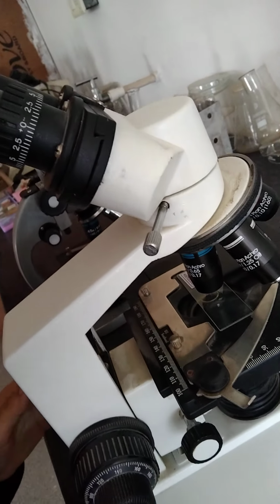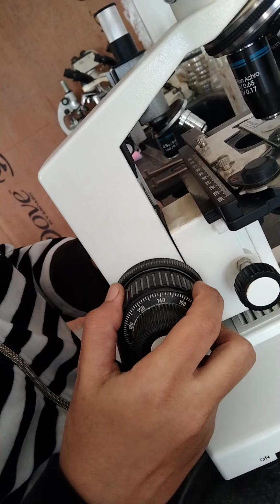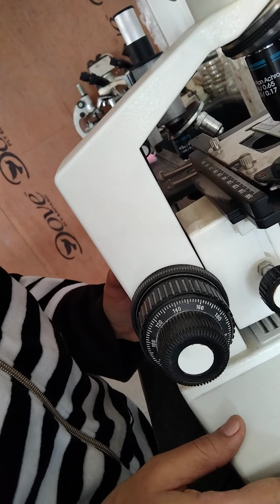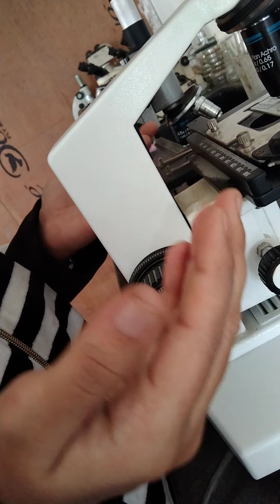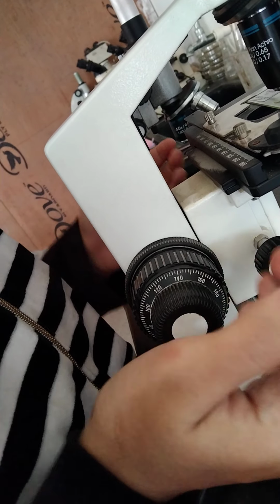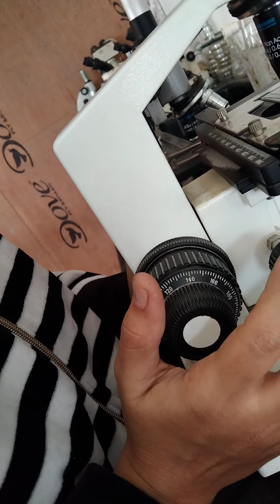Okay, now we will move toward the coarse adjustment. This is the coarse adjustment, the screw mechanism by which the body tube moves, or in the case of this microscope, the stage moves horizontally or vertically, right? It brings about a wide range of movement. So it can be raised or lowered quickly over a wide range to bring the objective approximately into focus, right? So roughly you can see your objects.